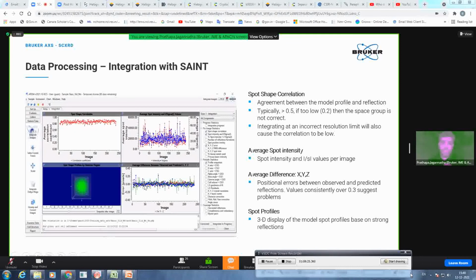And then the third graph is the average difference between observed and predicted spot. Actually, it represents the positional errors between your observed and predicted spots from your integration. So your orientation matrix should be falling around 0. That is good data. If it is within plus 0.3 to minus 0.3, it's still okay. But if it is crossing plus 0.3 to minus 0.3, then you know that you are integrating in the wrong unit cell or the data is not good.